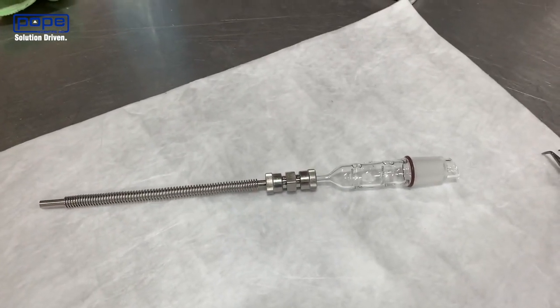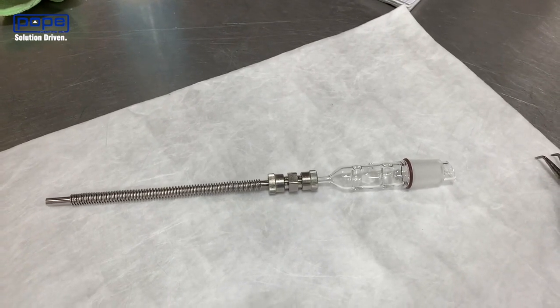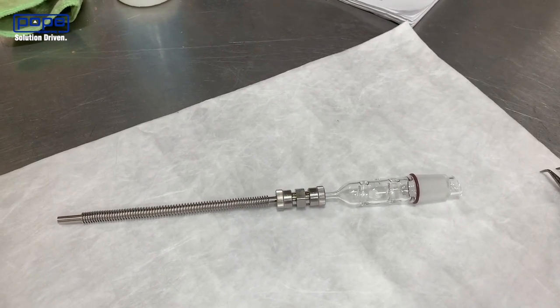It's a pressure fit. Once you apply vacuum to the system, everything's going to tighten down nicely. When you don't have vacuum on the system you should be able to pull it apart — that's not an issue. It's not going to cause pressure issues so long as the tubes are past the o-ring.